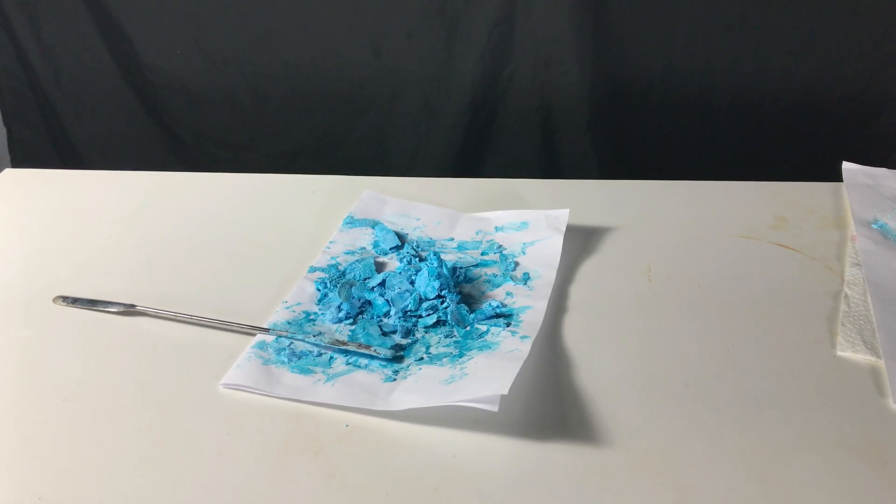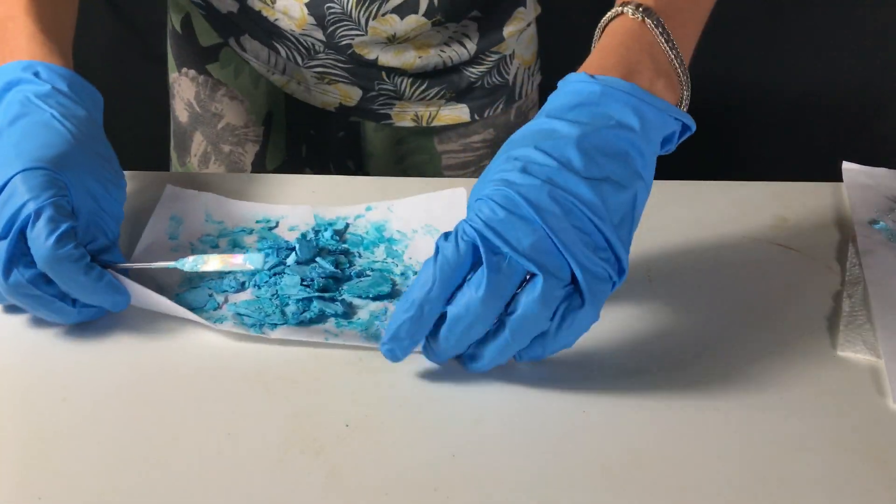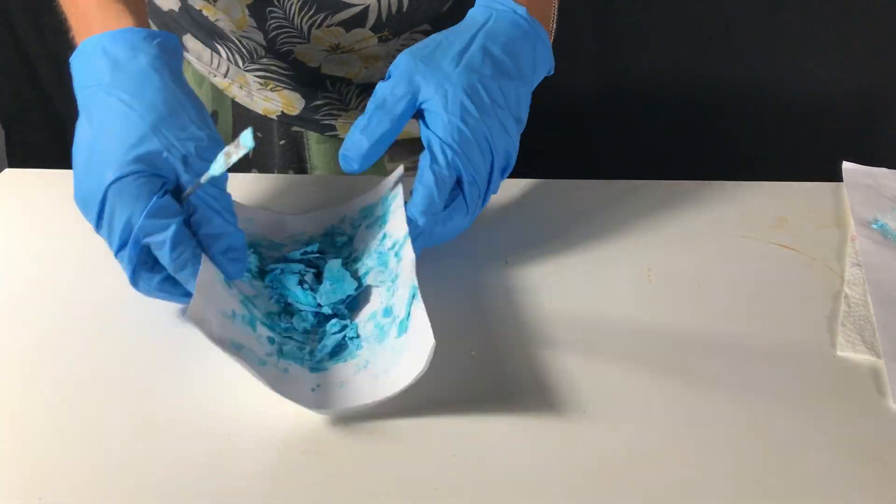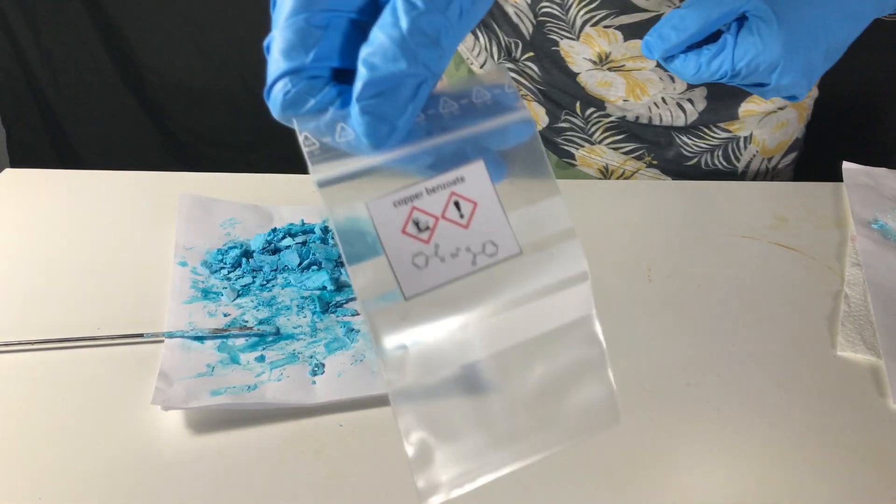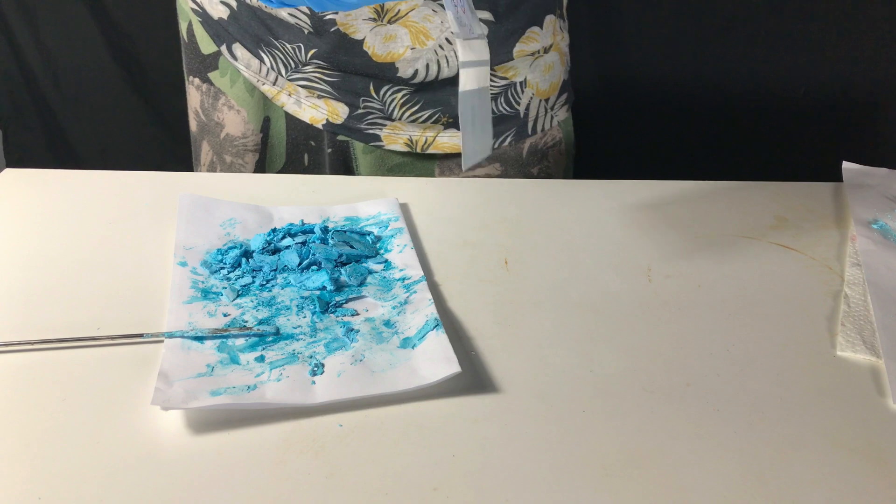The now dry purified powder was then scraped into a big pile. Afterwards, it was transferred to an appropriately labeled bag.